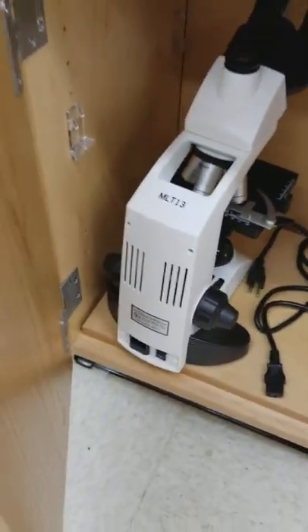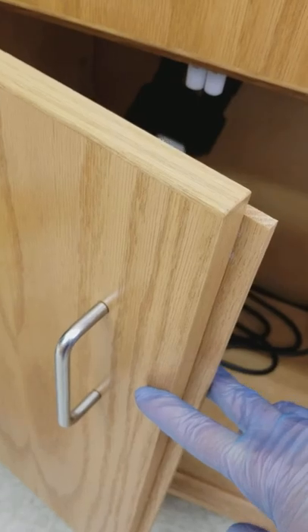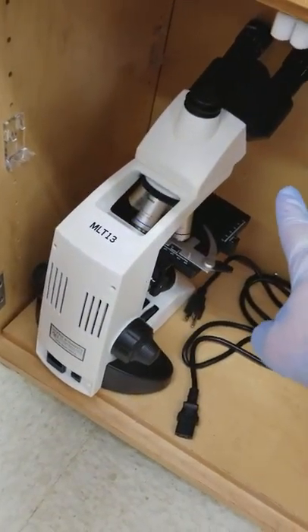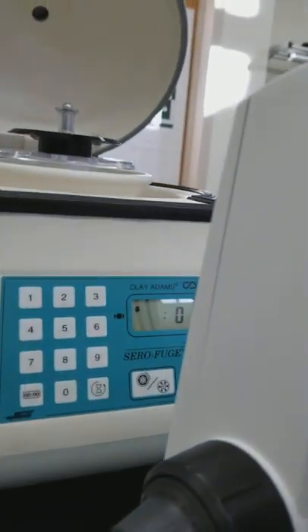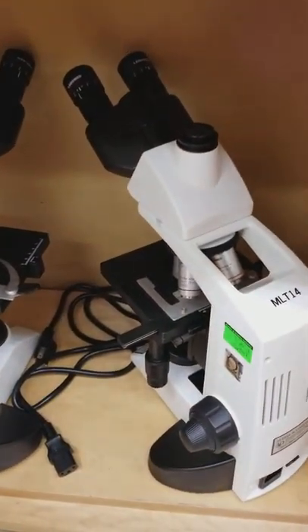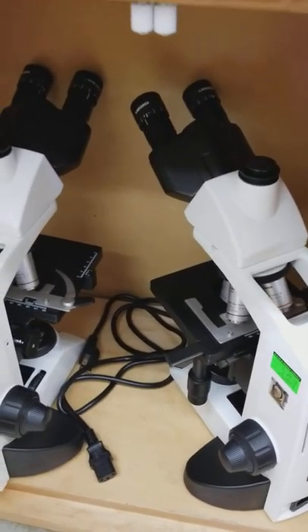When these doors close, a lot of times students are slamming them and it jams the microscope oculars into the back and damages the microscope. So make sure not to do that. You can even put it to the side like this so you'll see that the door closing is not going to hit it.